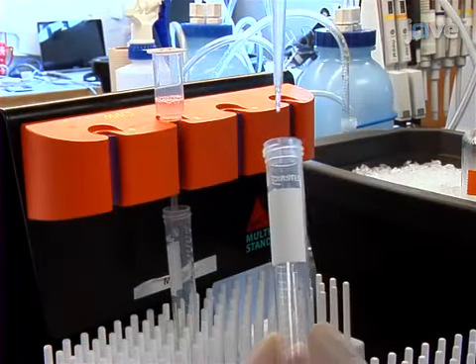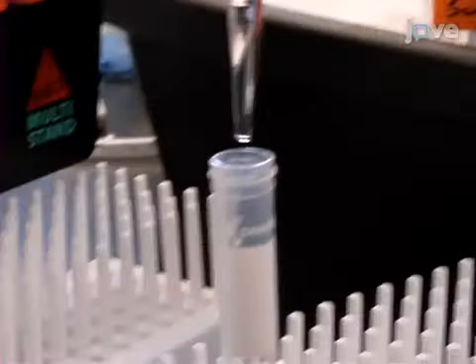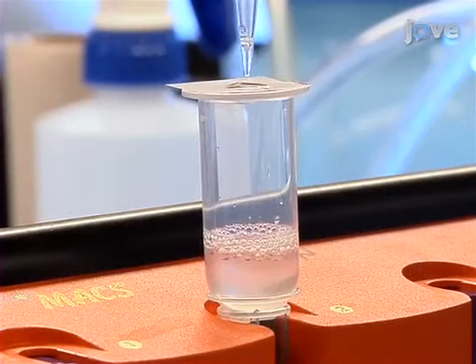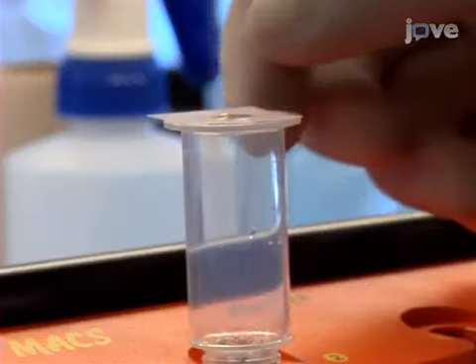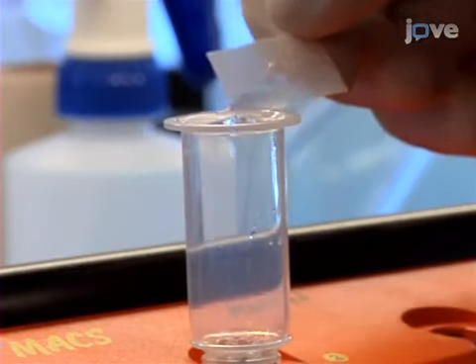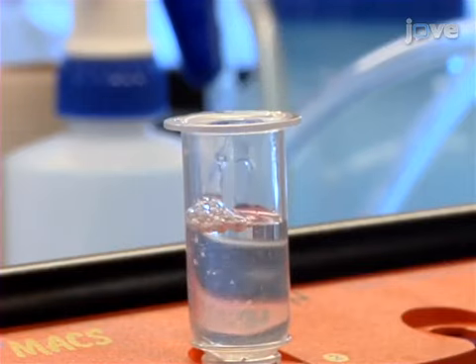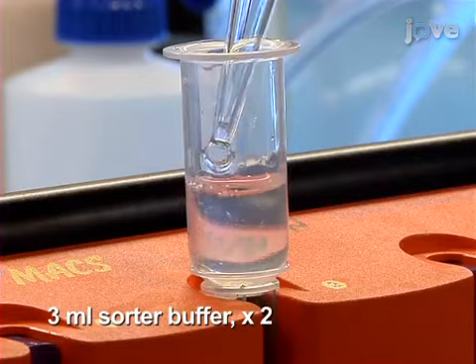When the cell suspension has completely drained into the column, rinse the original tube with another 3 milliliters of sorter buffer and transfer through the mesh onto the column, pooling the wash in the collection tube. Discard the nylon mesh. Then, when the buffer has completely drained into the tube, wash the column 2 more times with 3 milliliters of sorter buffer each time.